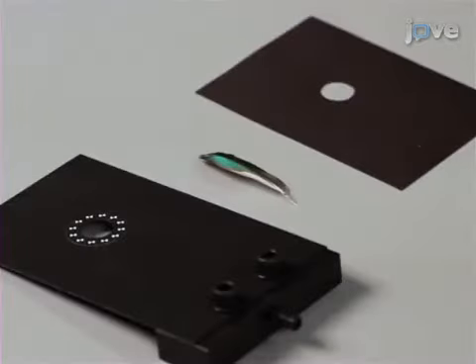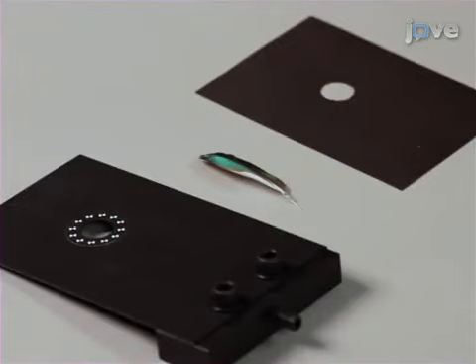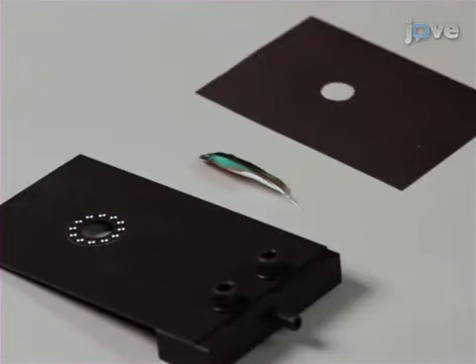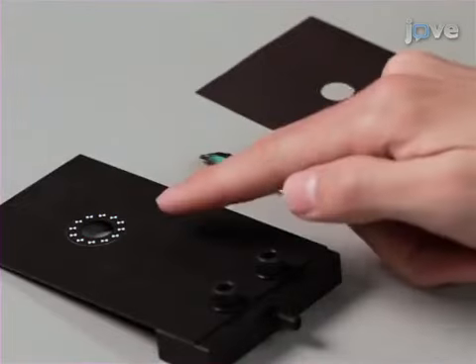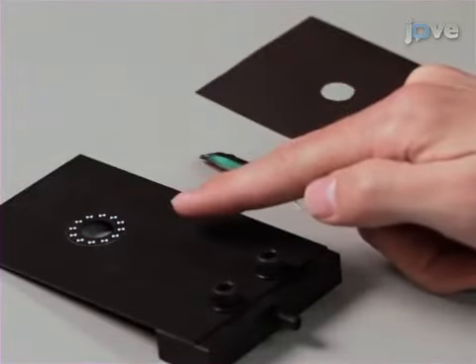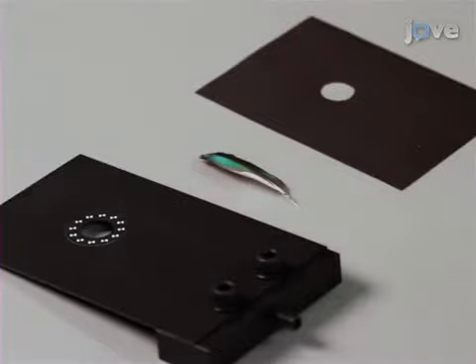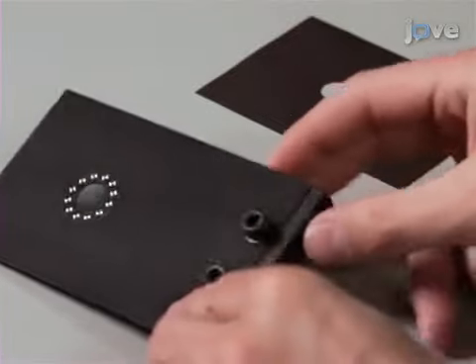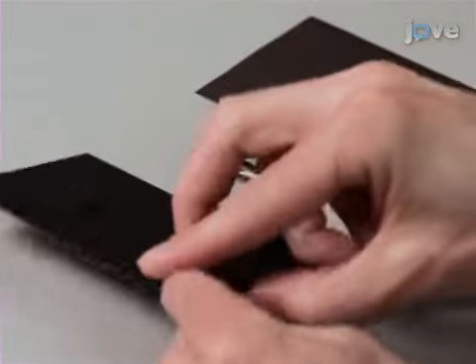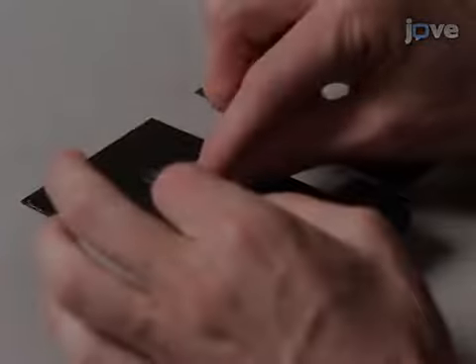As a first step in the experiment, obtain a thin ferrous metal mounting plate with an aperture of about half an inch surrounded by a ring of targets. Lay the feather to be studied against the back of the plate and center the region of interest over the aperture.